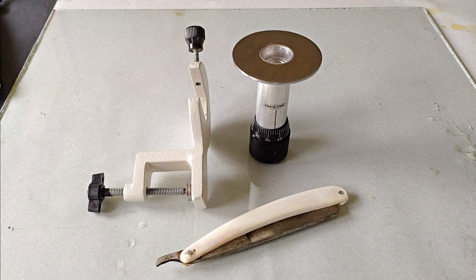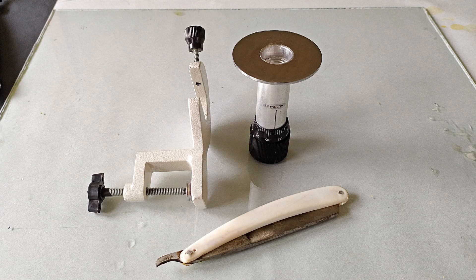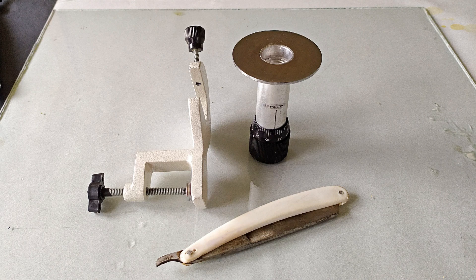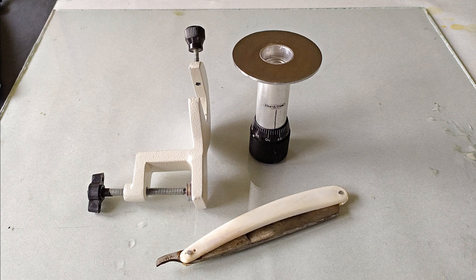In this video, we will be demonstrating the use and techniques involved in the hand microtome. The hand microtome is a portable, lightweight, simple to use and convenient sectioning tool that gives good results with plant specimens especially.